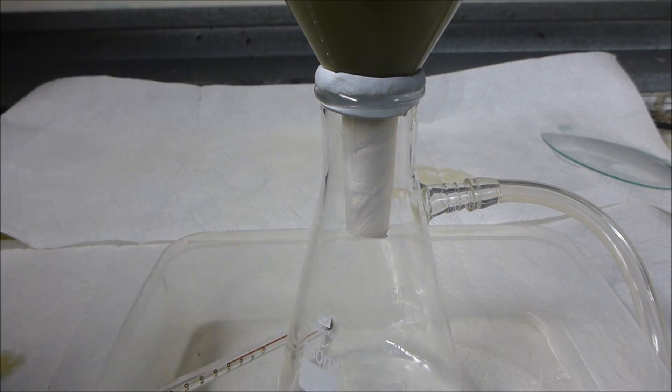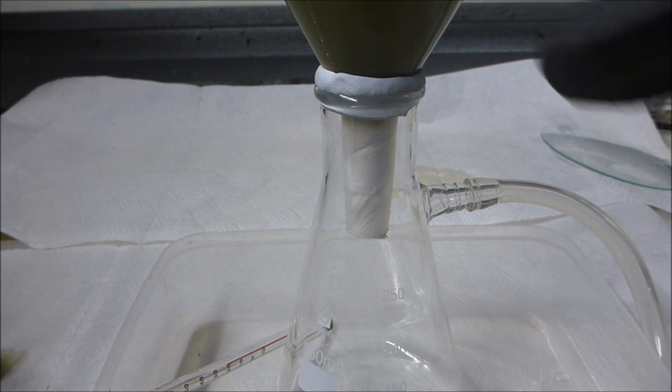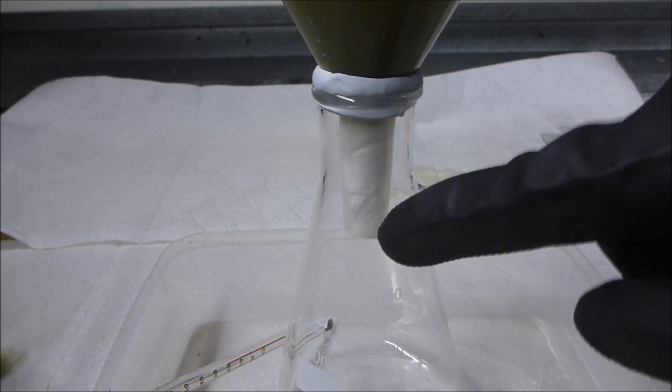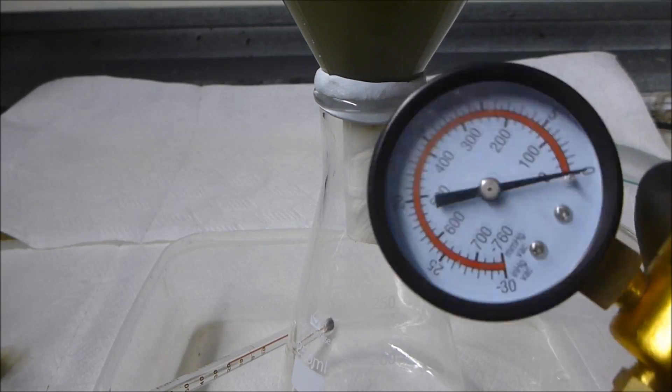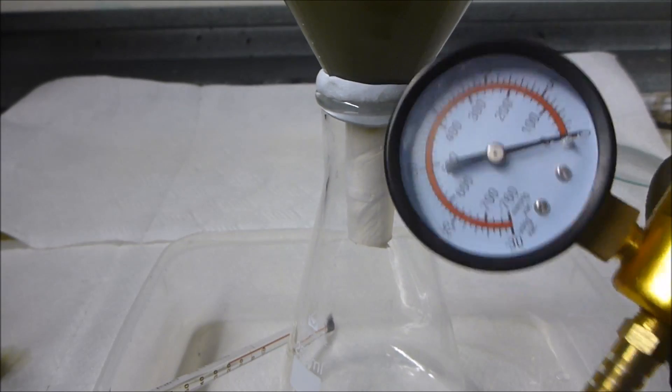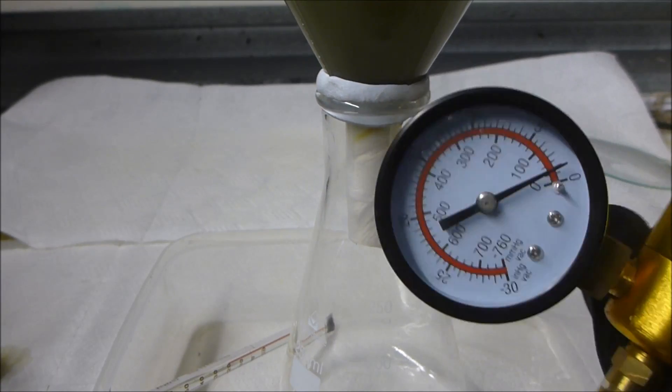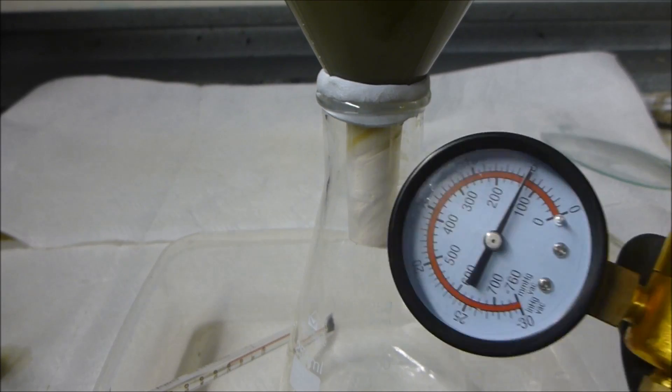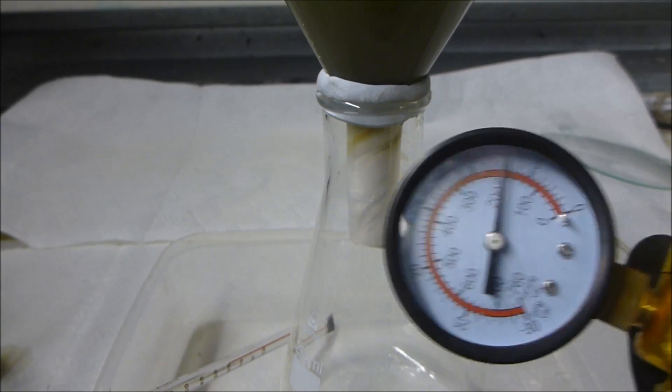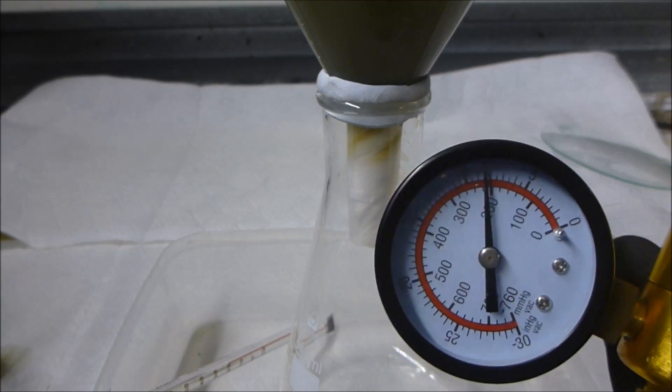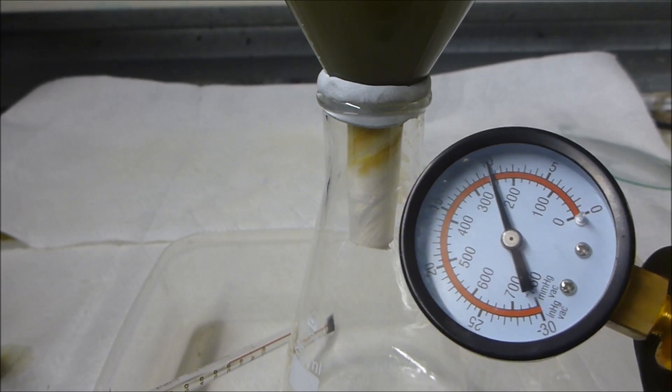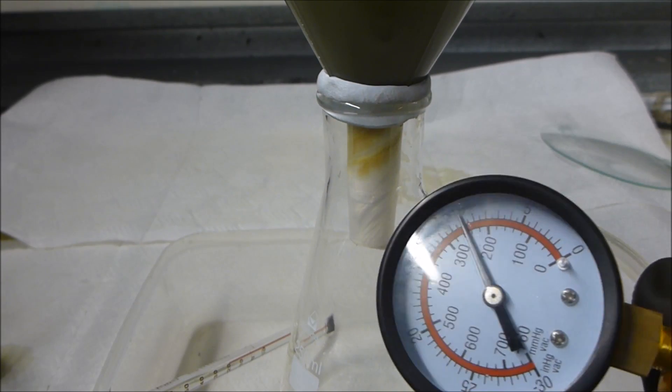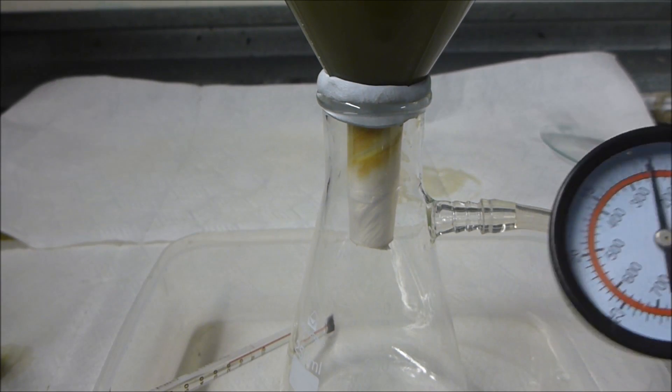You will notice we've got solution up here, nothing yet filtering through. The vacuum pump as you will see has no vacuum yet. What I'm going to do is start pumping. Initially what I'm doing is pumping all the air out of the system, but pretty soon all the air will be gone and you will start drawing a vacuum.